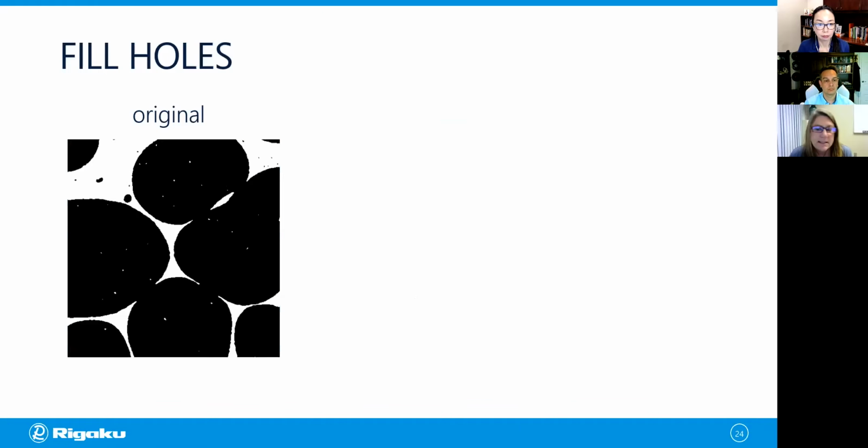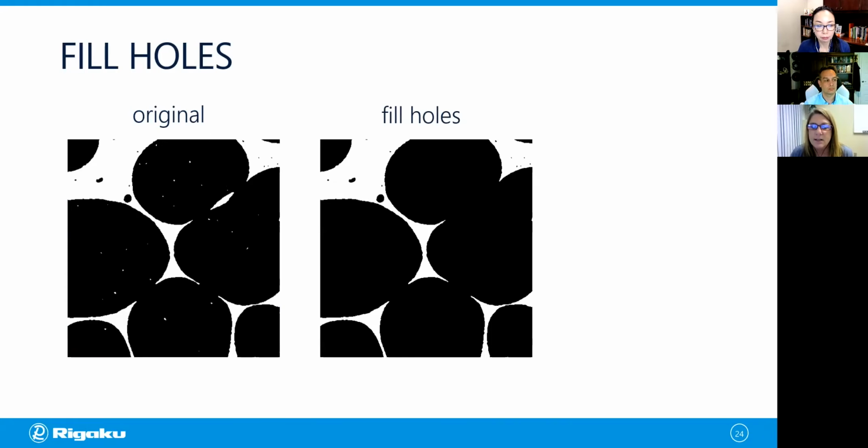So let's look at another tool, and it's called fill holes. And as the name implies, fill holes will remove holes inside of ROIs. And if we look at this example, we see it does a really good job of doing that. However, there's a problem. So if we look at the original and resulting images here, we see that the tool has eliminated a hole that was real. So we had two of these void regions, objects, connected to one another by two connections, and by virtue of that, it filled it. So the thing to consider here is if you have separated objects within your ROI, fill holes is a good tool to use. If you have connected ones, then be careful because it may actually fill the connections between them. So let's go on to our final tool before we work through some examples. This red circle is just showing you the area that was filled.